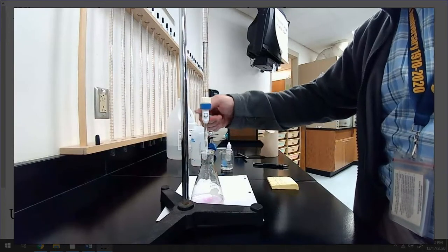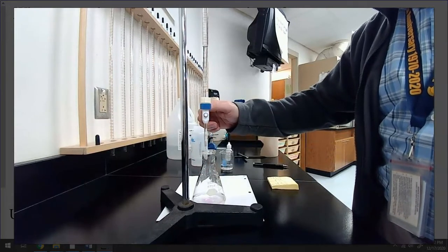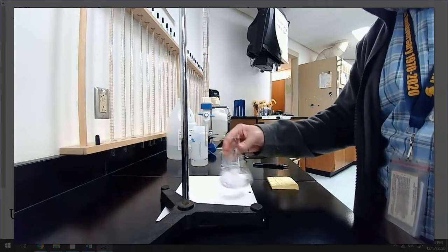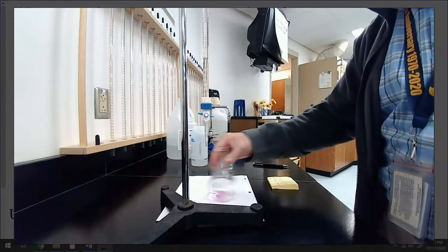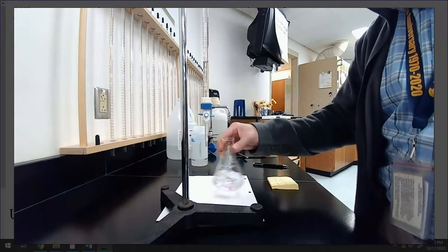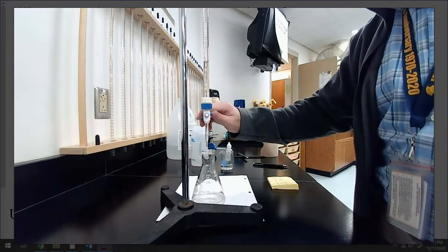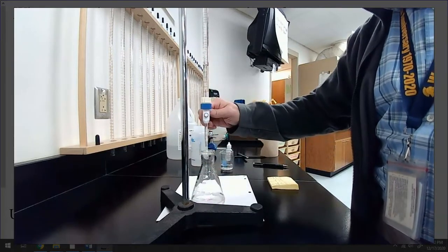Looks like this one's going to take more base than the first one, if I'm guessing. It feels like it's going to take more base. Yeah, I think it definitely is. Yep, without a doubt. Uh-oh, hopefully I have enough in here. Getting all smart about not having to refill my burette. Gonna come back and bite me, it looks like. Yeah, maybe not. How are we looking? I think all my solid acid is dissolved, so maybe I might be okay here. Oh, I hope so.